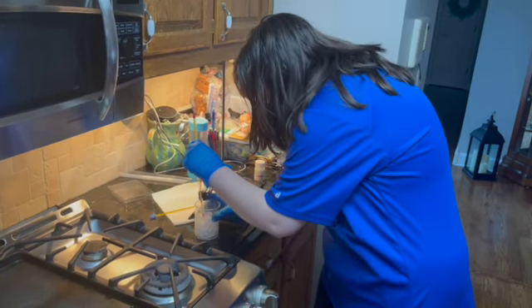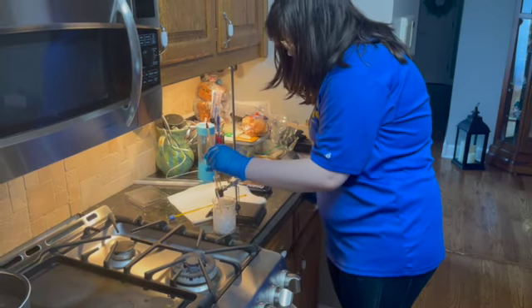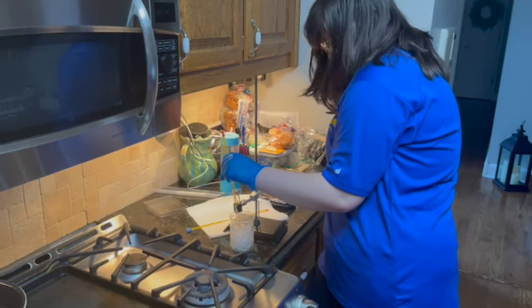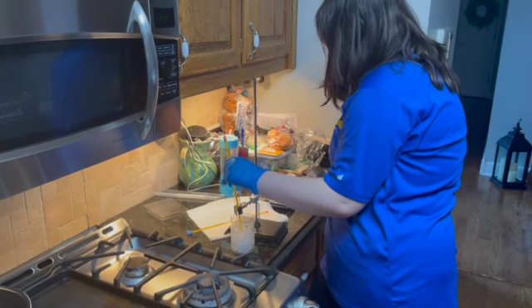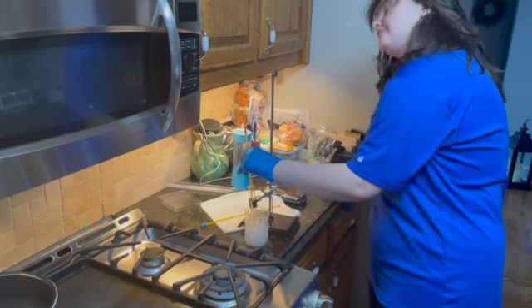And trying to take a closer look at it, there seems to be a little bit of condensation on some areas that are just air pockets because of the ice not fully going in. But we are getting close to our minute mark. And so once I get there, I'm going to state the temperature.